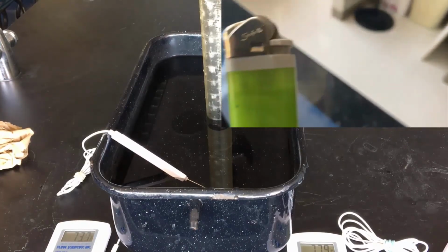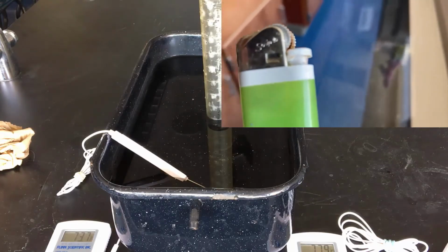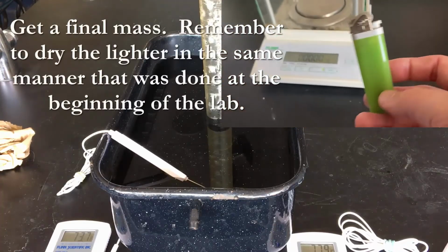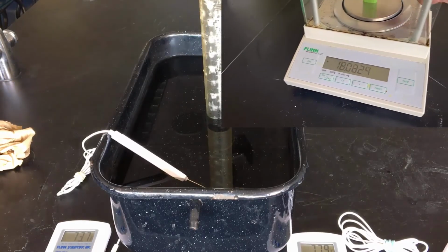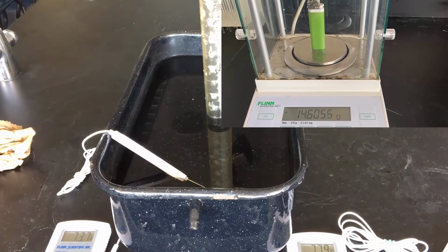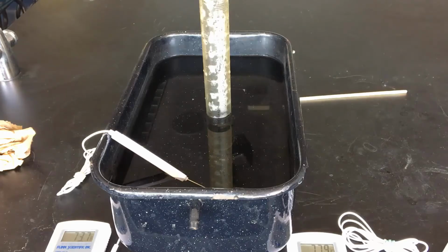While we're doing this, we're waiting about 5 minutes to see what happens in the graduated cylinder. Now, notice those two temperature differences. The volume of the gas might actually change over 5 minutes. We're really hoping that the water level inside and outside of the graduated cylinder are equal. If they're not equal, then that could be a problem with our pressure. It could indicate that we still have a lower pressure on the inside, or perhaps a higher pressure on the inside than on the outside. And that can cause some issues with some of our calculations.